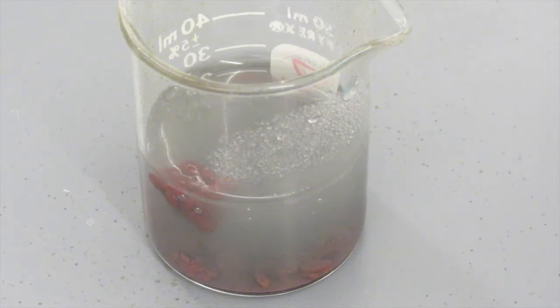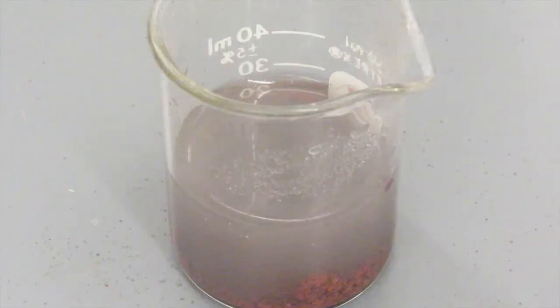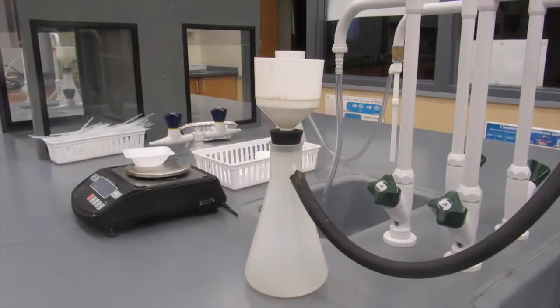You know there's still time needed for the reaction because you'll still see the aluminum floating on the top of the solution. Here, most of the copper is all sunk, so you know the reaction is complete.